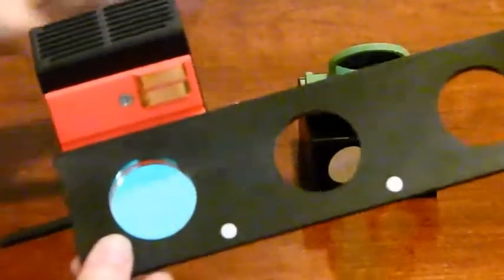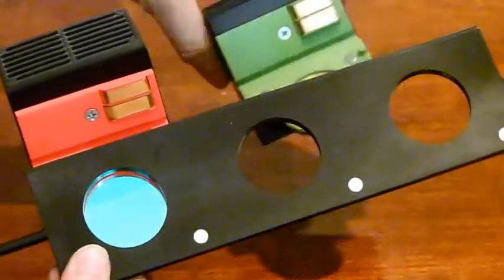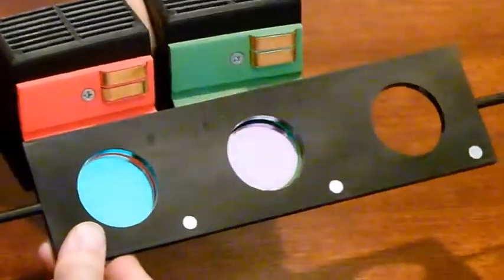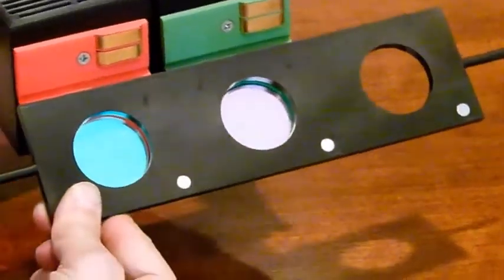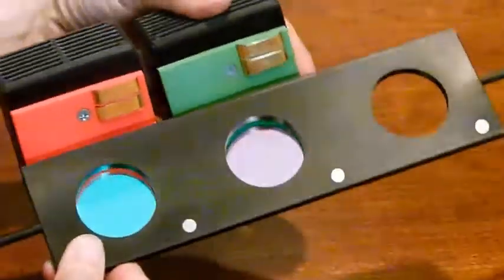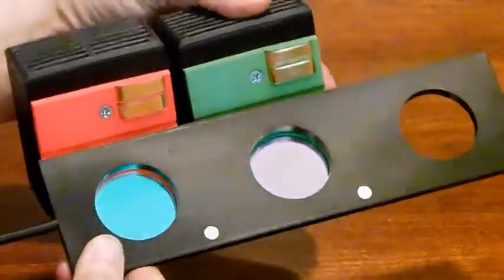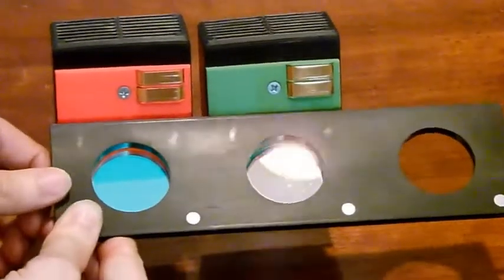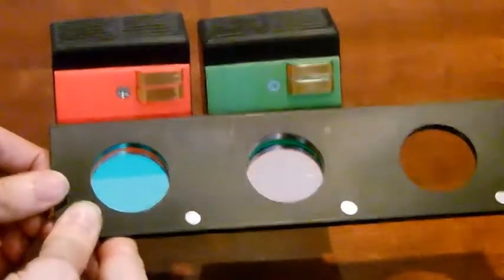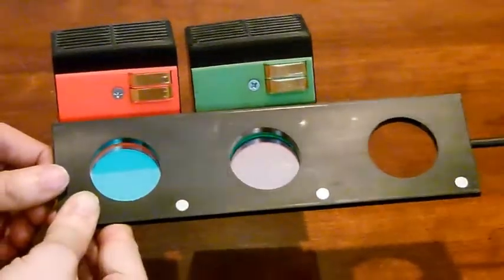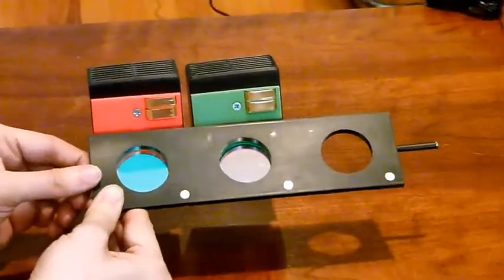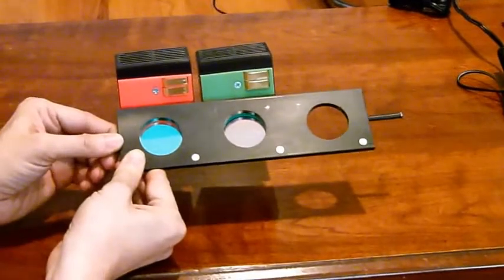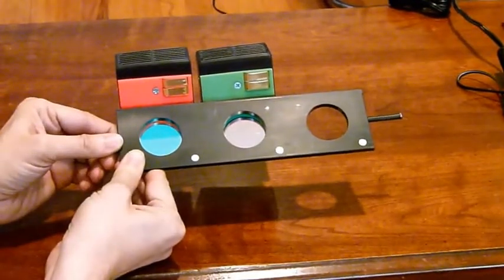And here's the next one. And that one snaps into place as well. And you can put them in any order that you want for ease of use for your experiments.